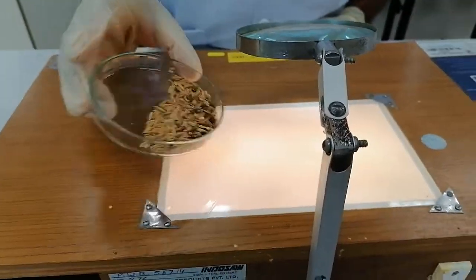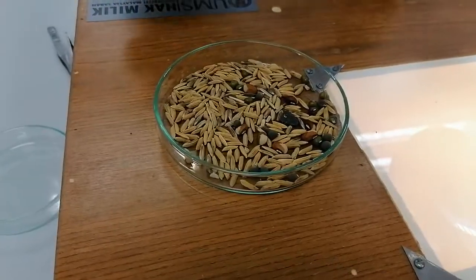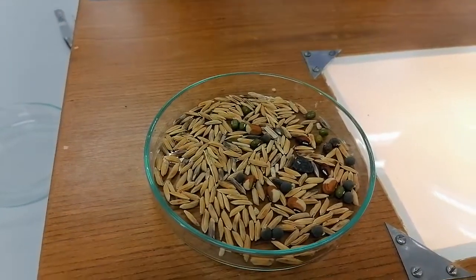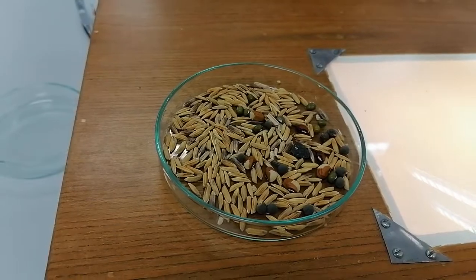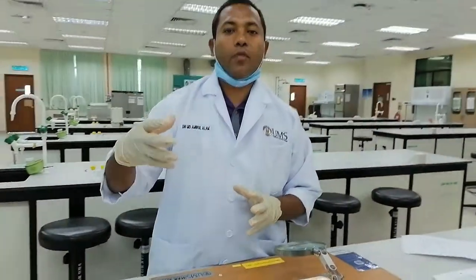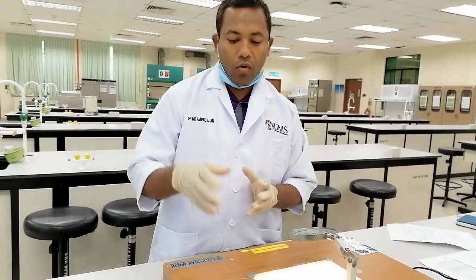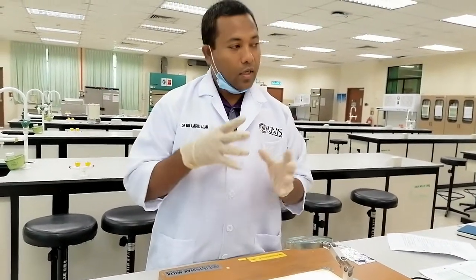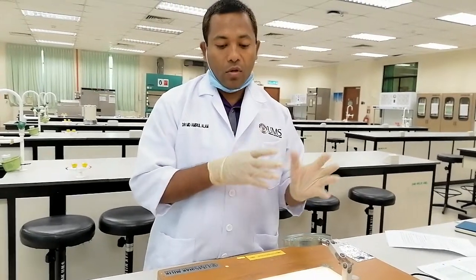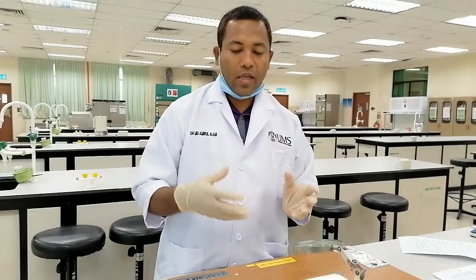This is our mixture of seed. For practical purposes, we have just mixed different types of seed and inert matter. In practice, we collect from the field after harvesting or after processing, then determine the percentage by collecting the sampling. Last time I already showed you how to do the sampling. From the working sample, the first analysis we do is the purity analysis.